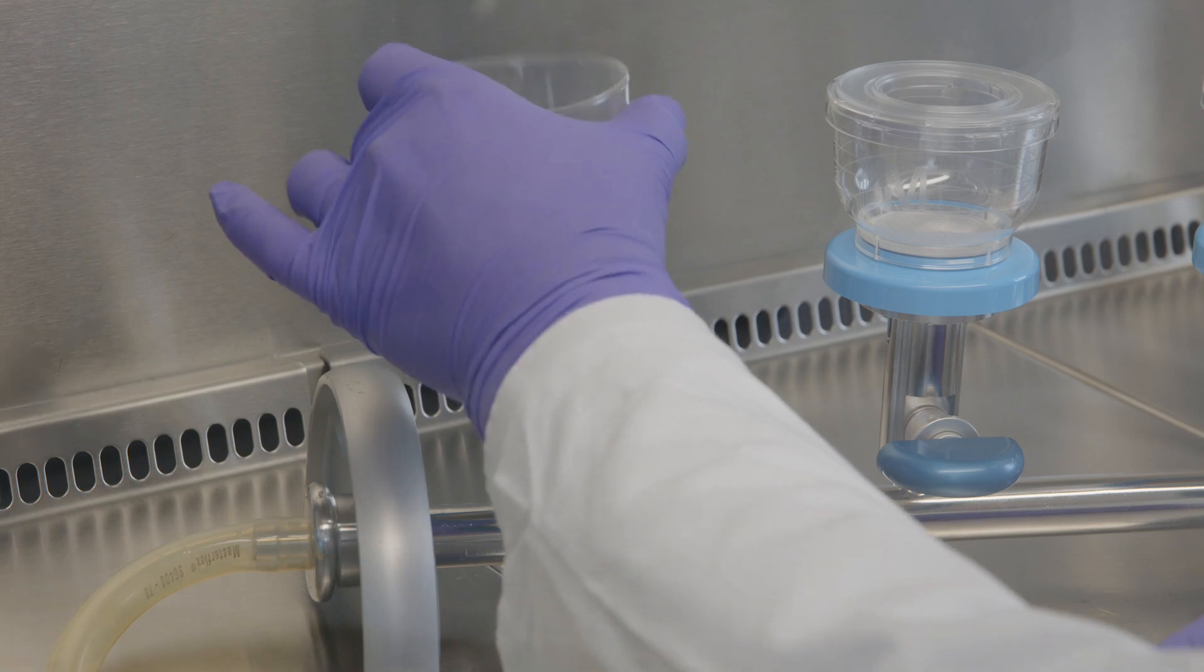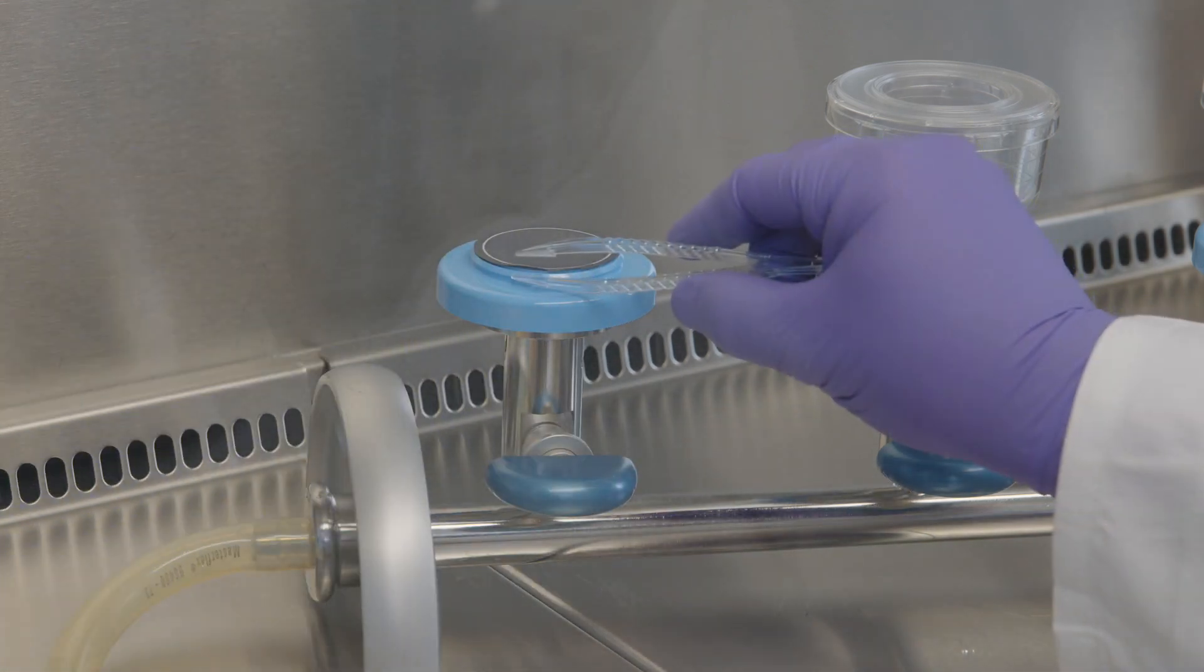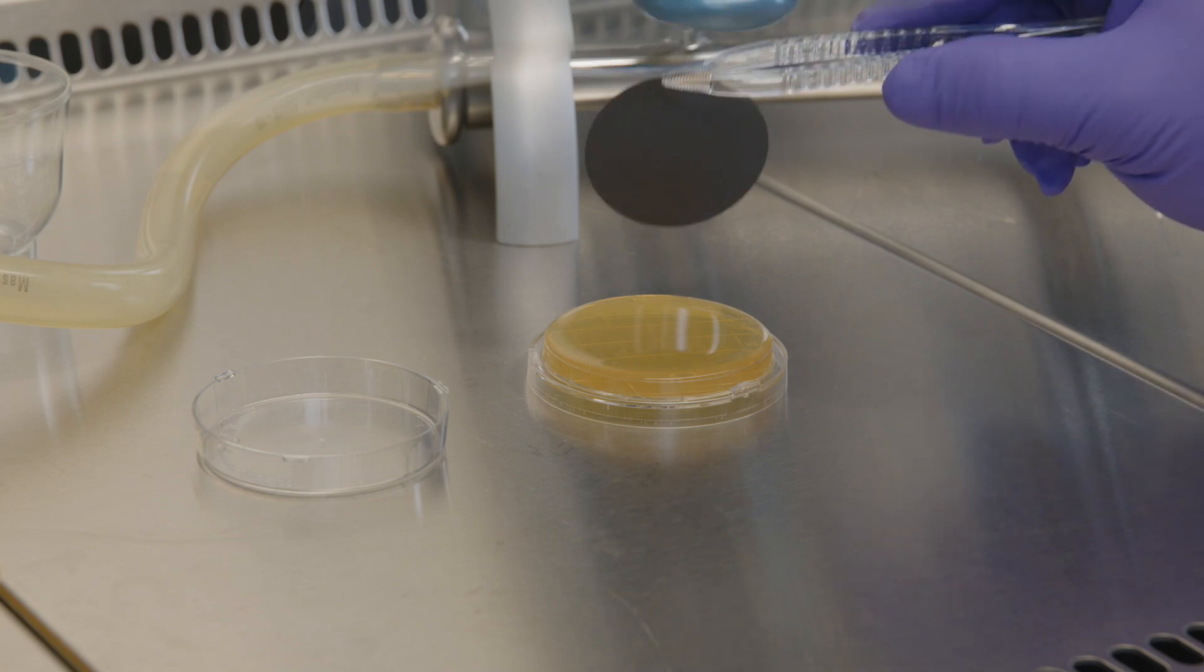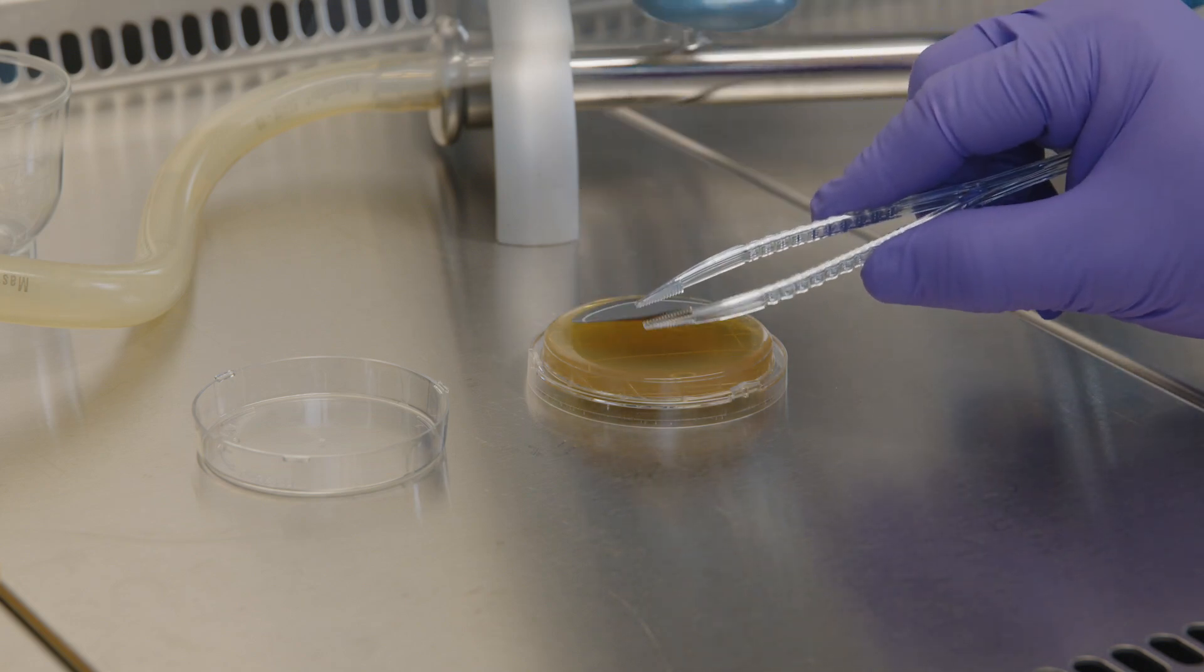Once completed, remove the funnel of the filtration unit. Then carefully remove the membrane with the forceps and place it on an agar plate.